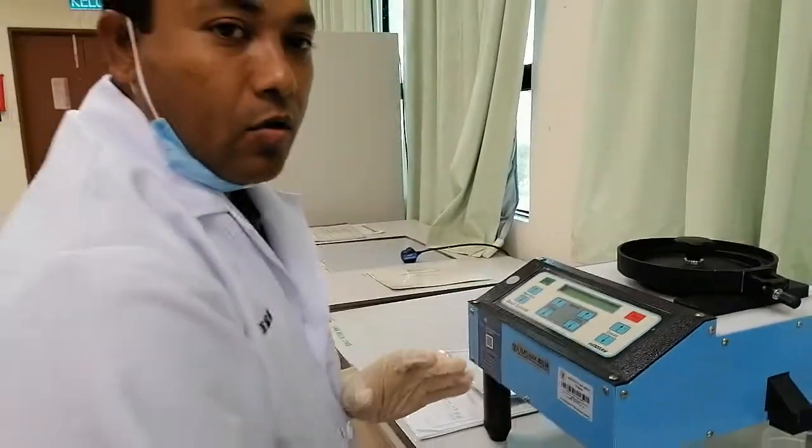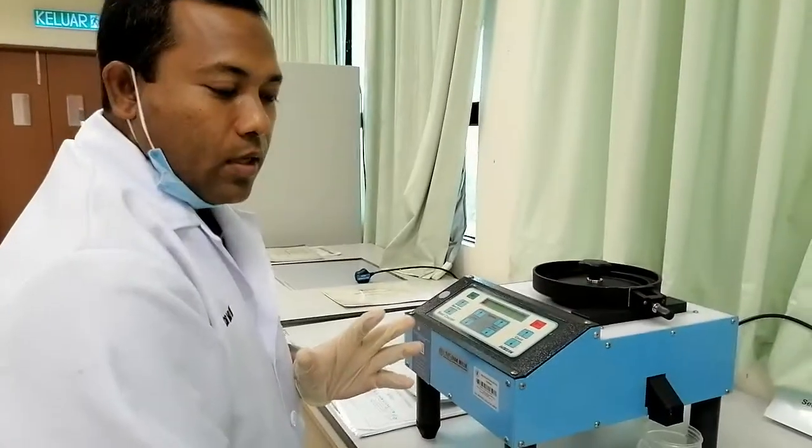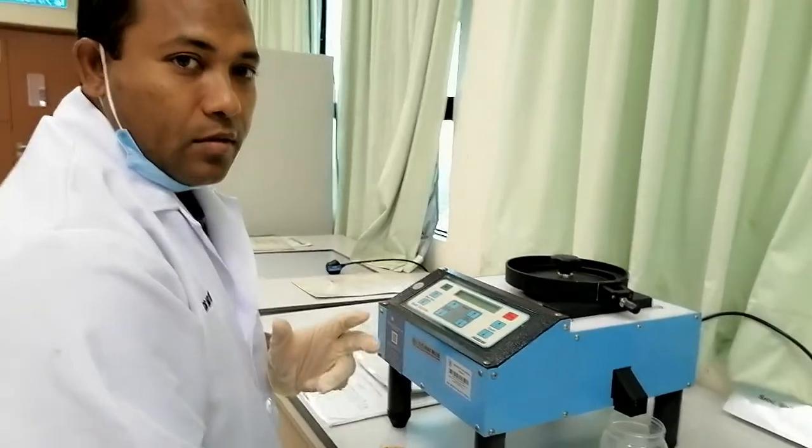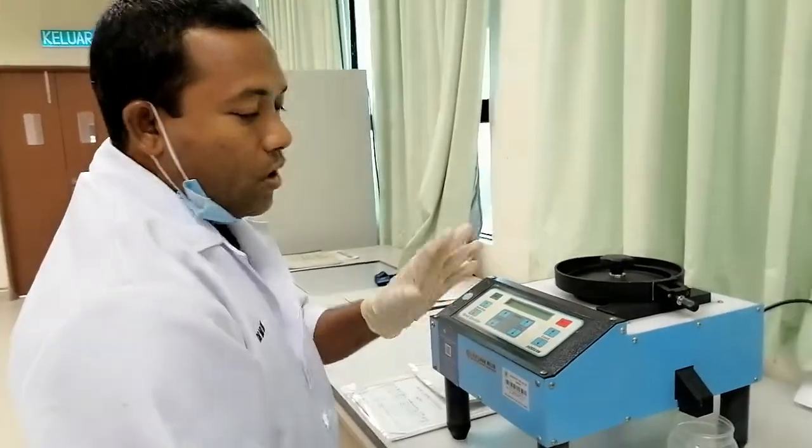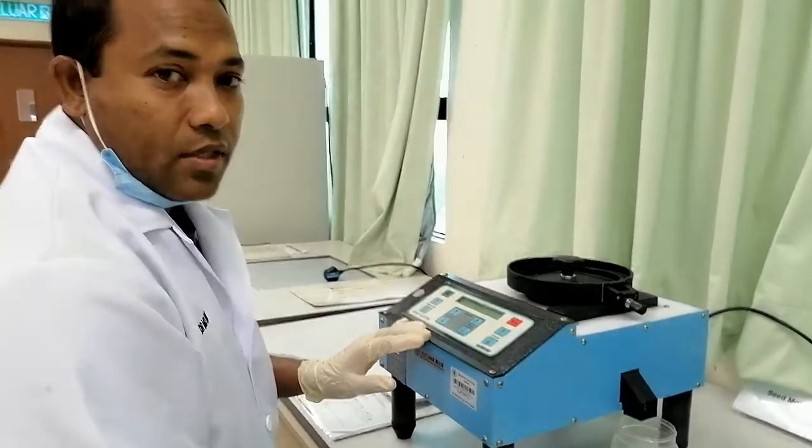Today my dear student, I want to show you again how to do the counting of the seed. So this is the seed counter. By one by one, it is very difficult to count the seed.